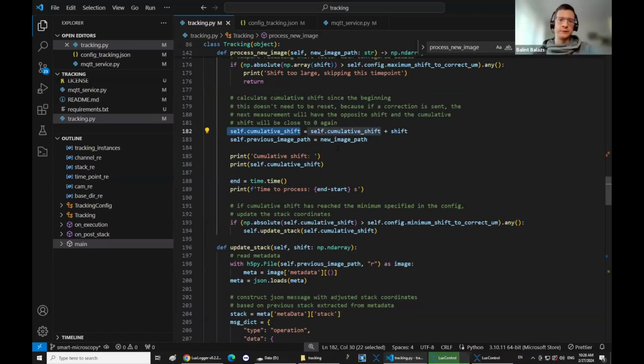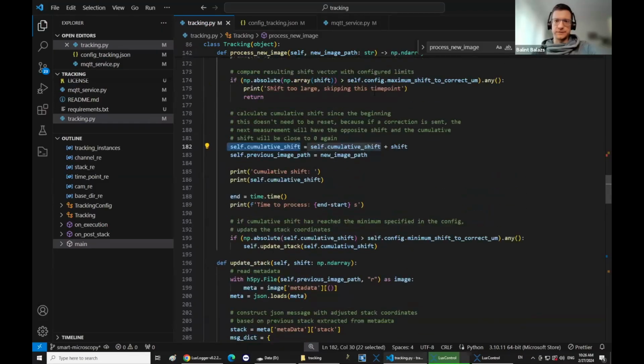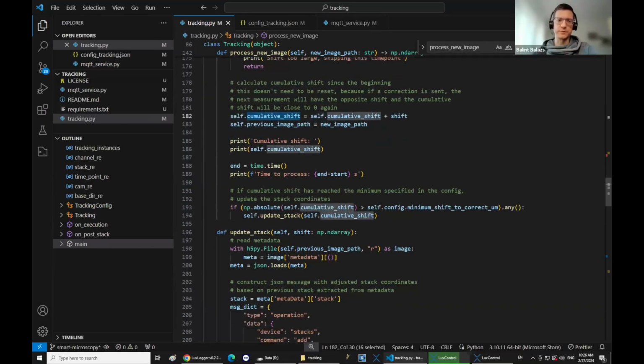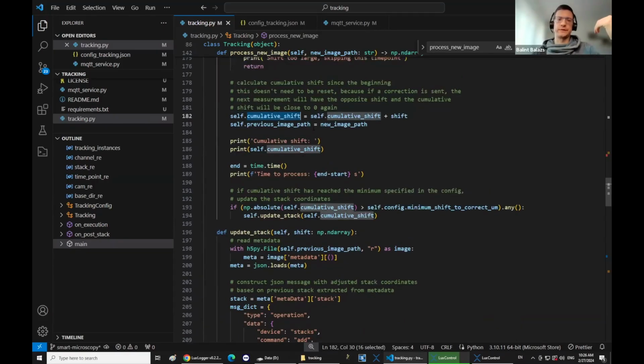Okay, sorry, if it's more than this maximum shift, then it's an error condition, so that's why it just returns. And then if everything was good, then it keeps track of the cumulative shift, because if in the previous time point it was not big enough, for example, then it has to keep track of the shift of the previous, and then it just adds it all up until it's bigger than what you configure in this minimum.